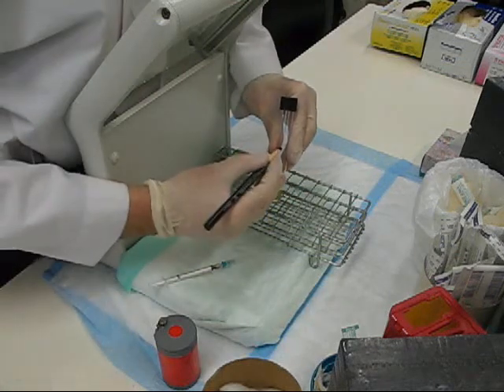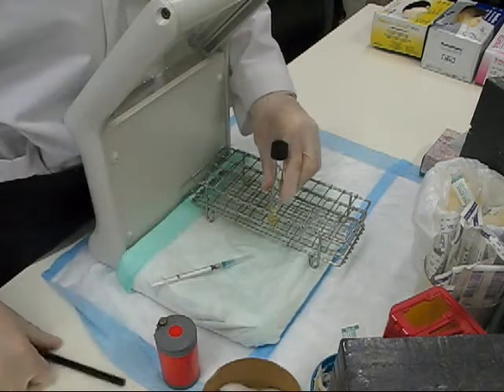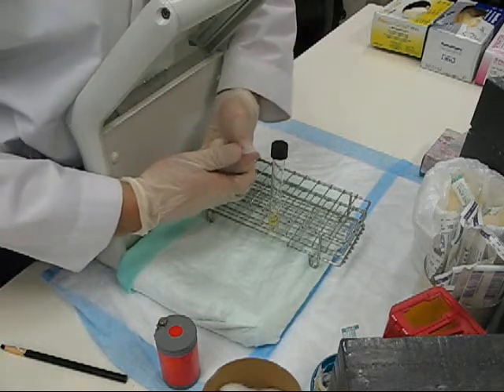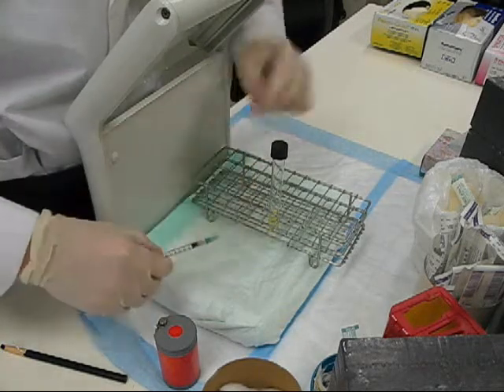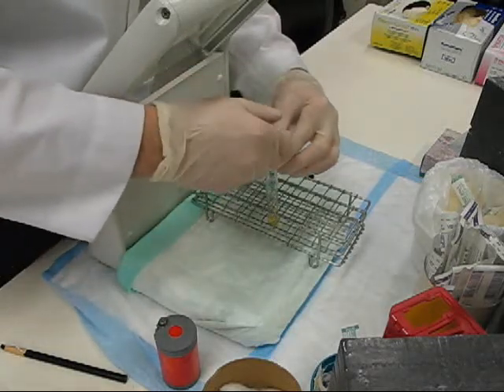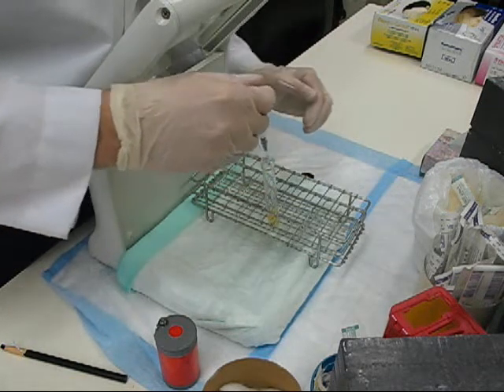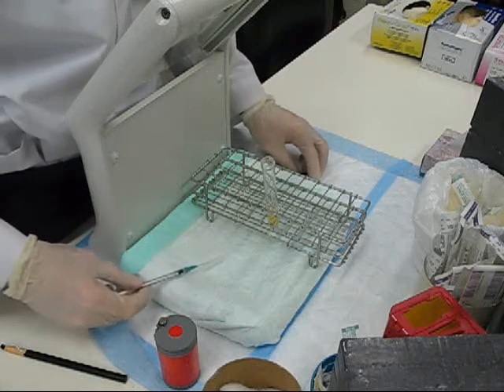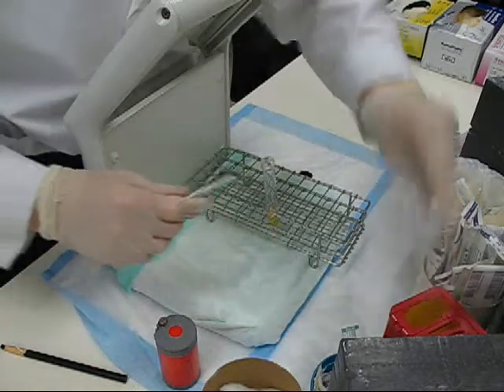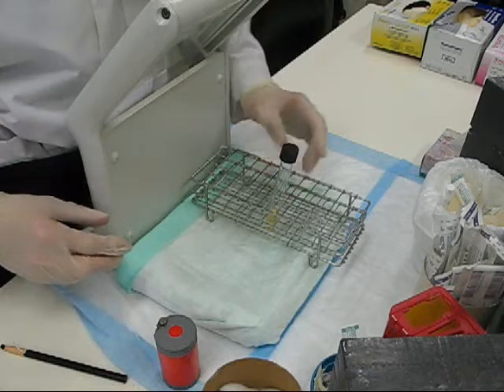You'll label the test tube with your name using a grease pencil, being sure that the remaining component of your QC volume doesn't touch the side and actually gets into the growth medium. Go nice and close to the growth medium at the bottom and squirt the remaining contents. Recap safely, discard the needle on the syringe appropriately, then recap your sterile medium and put it back in the refrigerator.